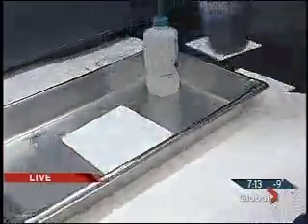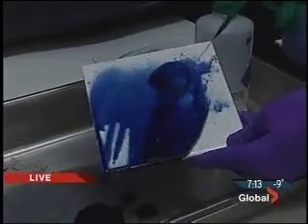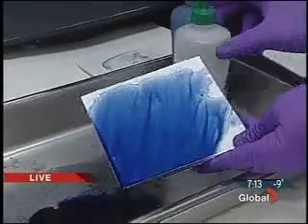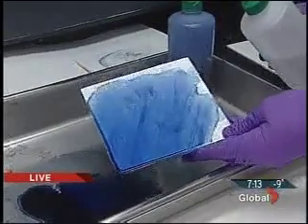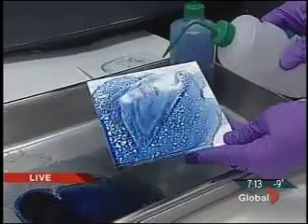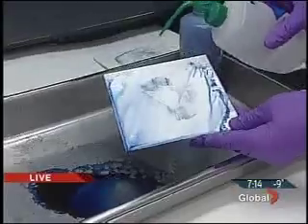I pour the chemical on here. Go ahead. Watch this. I let it sit for approximately 15 seconds, and then I will rinse it with some methanol. And we will see a better palm print. It enhances it. It reacts with the proteins that are present in the blood and makes the blood visible. And look at that. That enables us to make an identification, hopefully to a suspect of a crime.